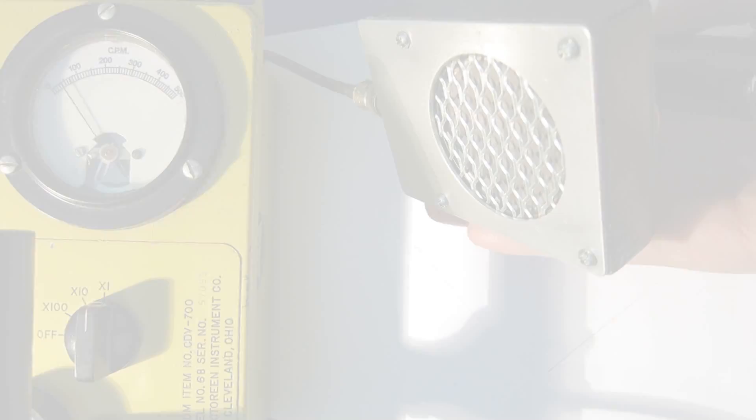So I put up this balloon outside for one hour, then I popped it, put it into the bag, and it was ready to be measured.